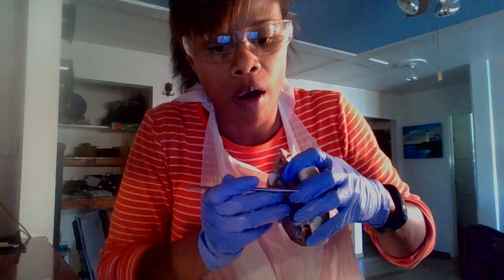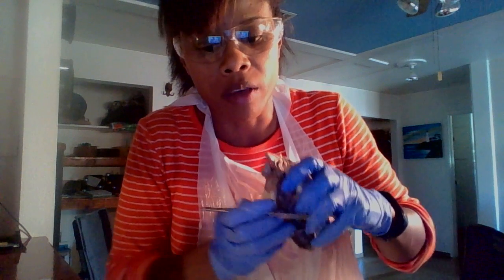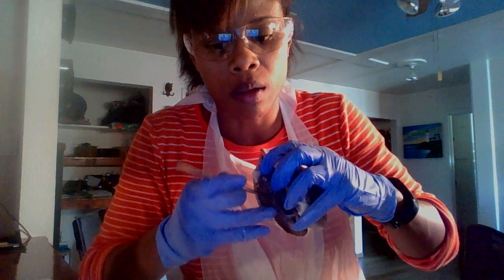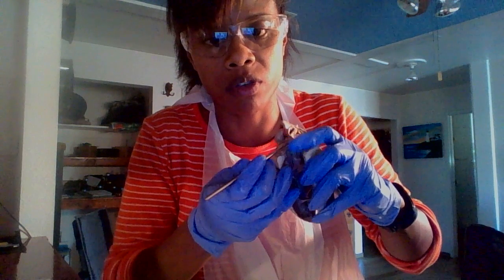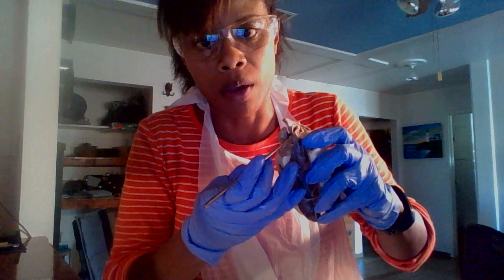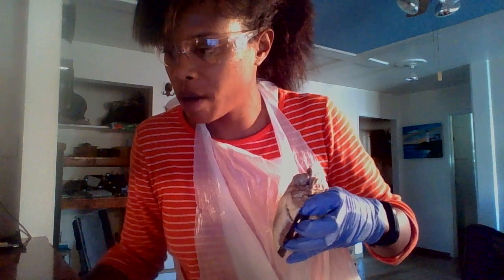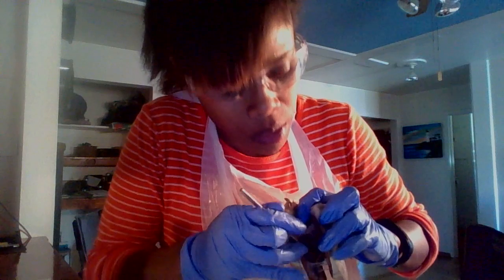I forgot to mention the myocardium. The myocardium on the left ventricle is thicker because the left ventricle ejects blood into the aorta, which is the largest blood vessel in the body. Then we have the papillary muscles, which are down here.